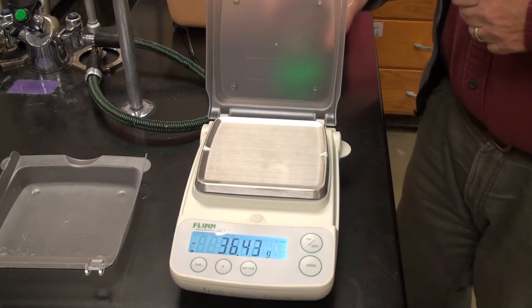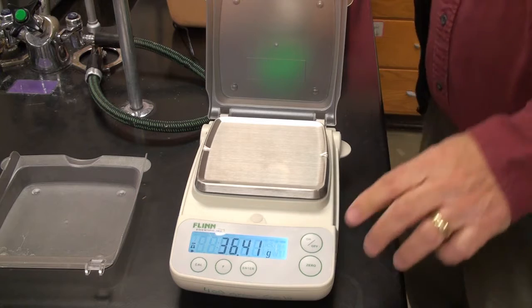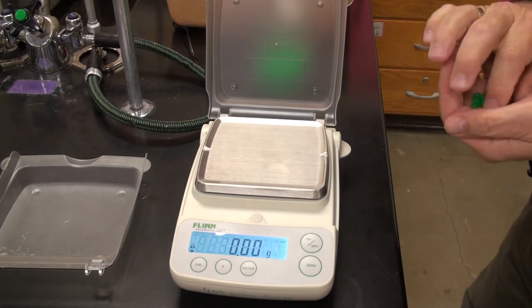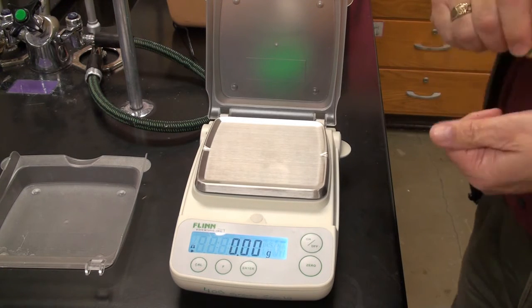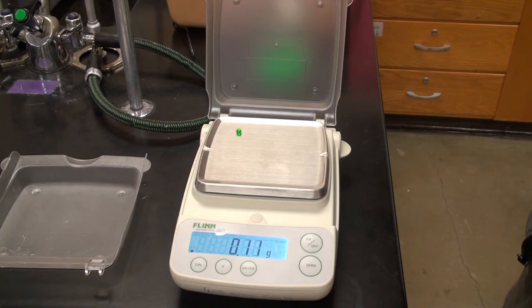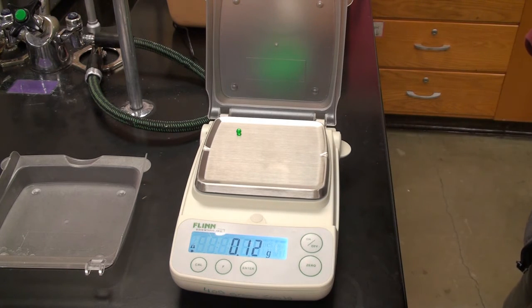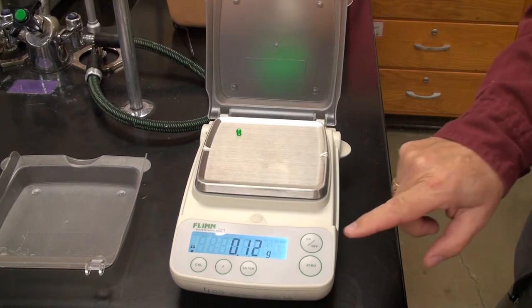Okay, so these are the small green ones, the Airsofts. There we go. There's one, that's stable. Ooh. Now it looks stable.